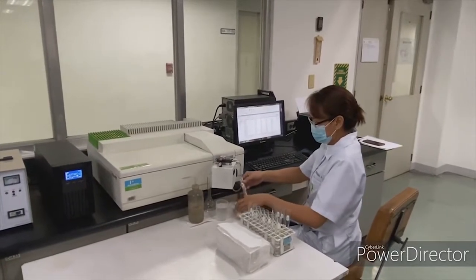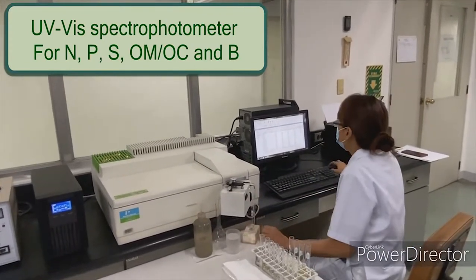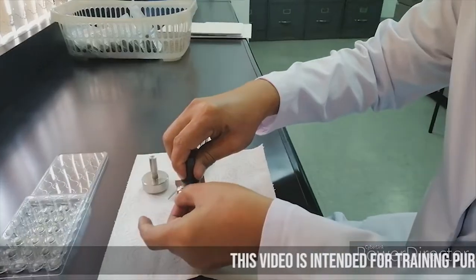The samples are analyzed using the UV-vis spectrophotometer for the determination of nitrogen, phosphorus, sulfur, organic matter, organic carbon, and boron.